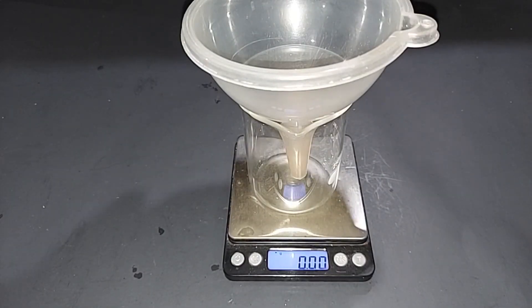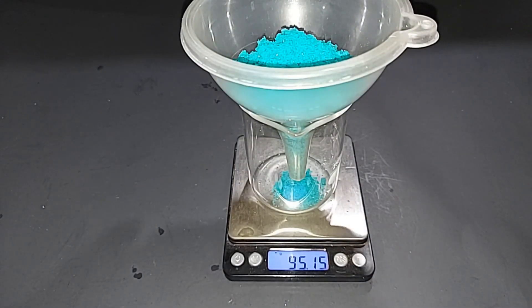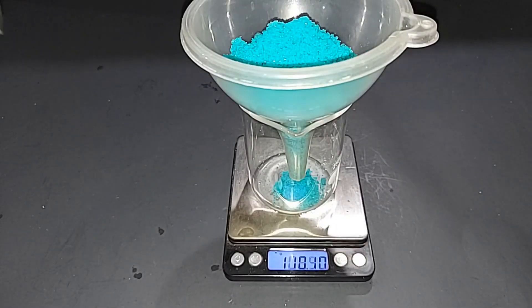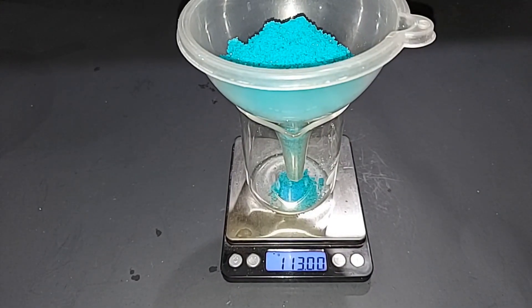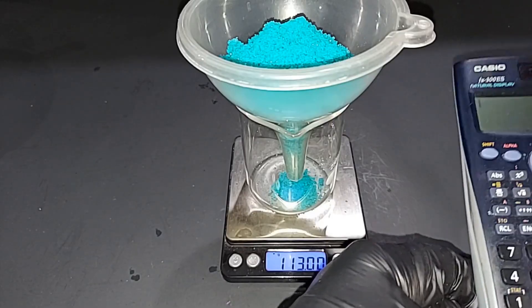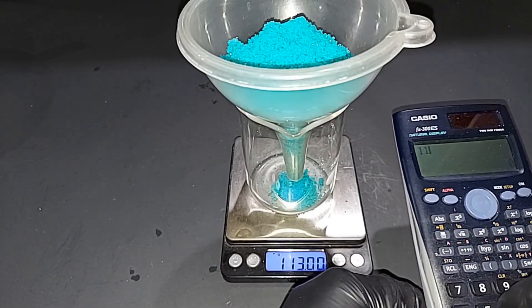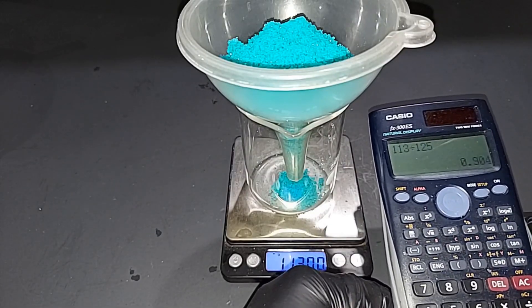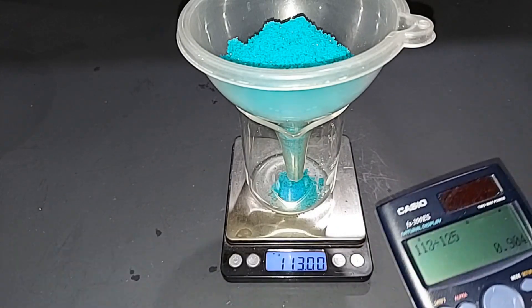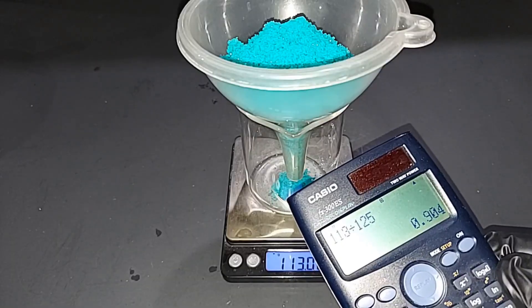It's done - it air dried overnight nicely, so all we need to do now is weigh it. 112.95 grams - well it bounced up to 113 grams. With 125 grams theoretical yield, I'm going to take 113 divided by 125 and we got 90.4%, basically 90% yield, which we'll take. Not too bad.